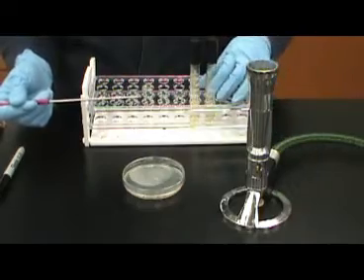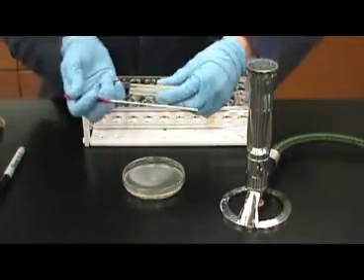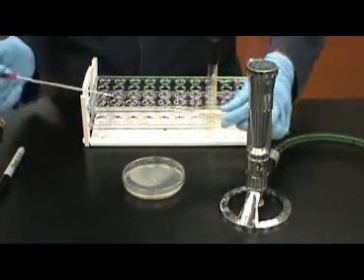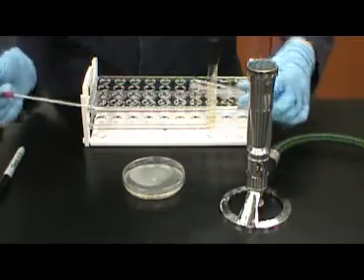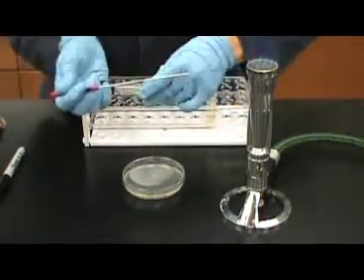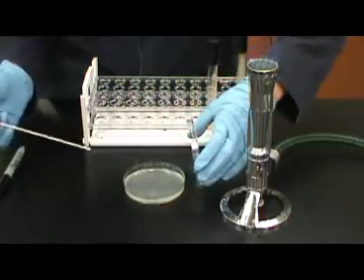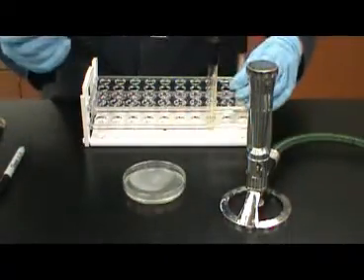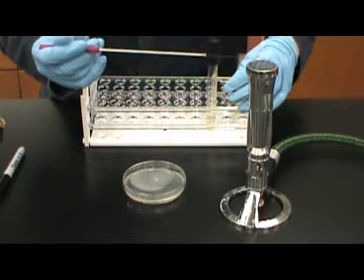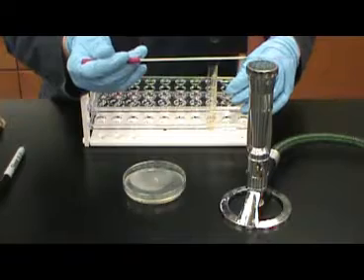Starch hydrolysis is the breakdown of the different forms of starch found in the environment. Bacteria can produce several different forms of enzymes used for the breakdown of starch. The enzyme we will be testing for is amylase. Amylase is used to break down a form of starch known as amylose. Amylose is a simple or linear starch found in breads, grains, fruits, and other foods.